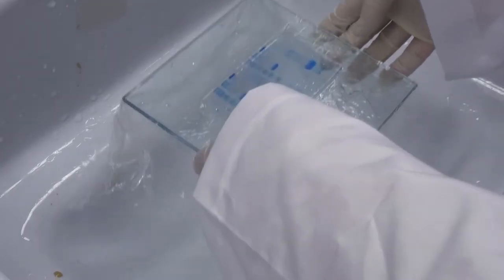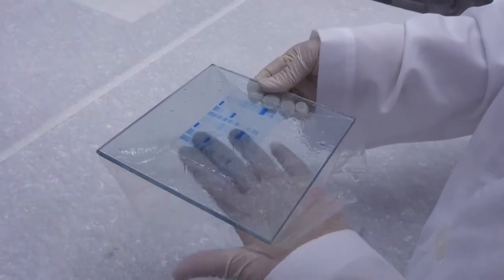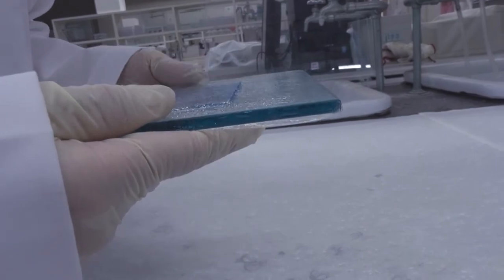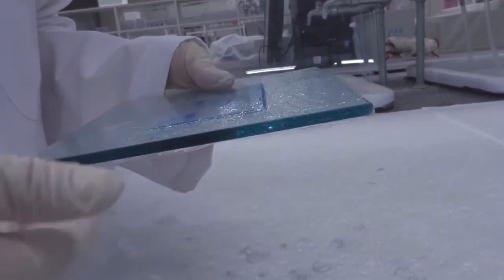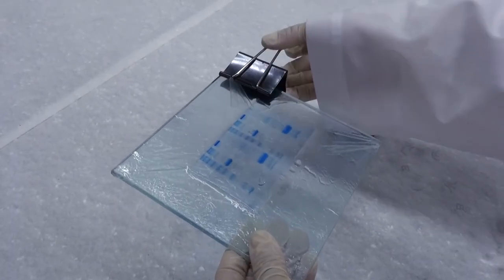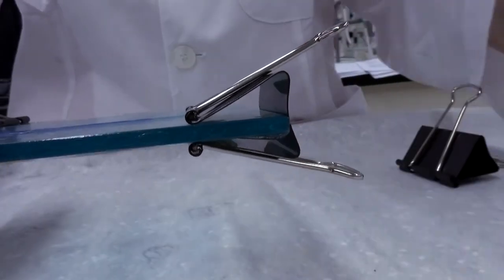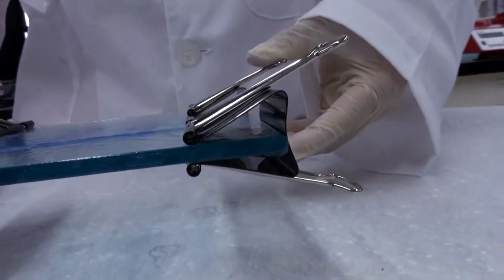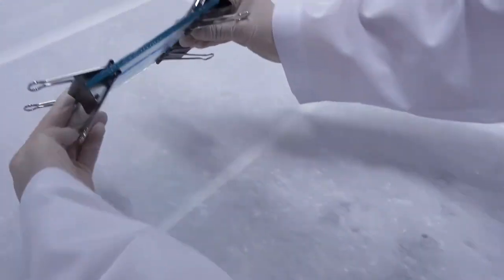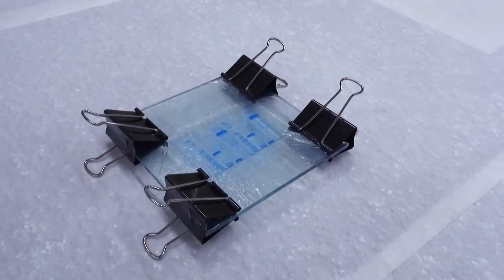Raise the glass plate. Fold the oversized part of food wraps downward around the edges of the glass plate neatly. And secure with binder clips at the corners and edges of the glass plate. Next, inverse the plate. Let it stand and dry.